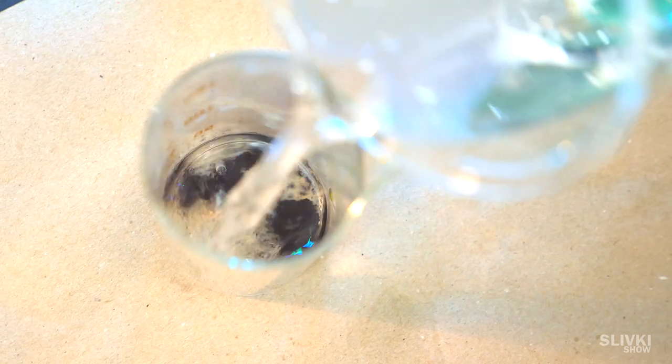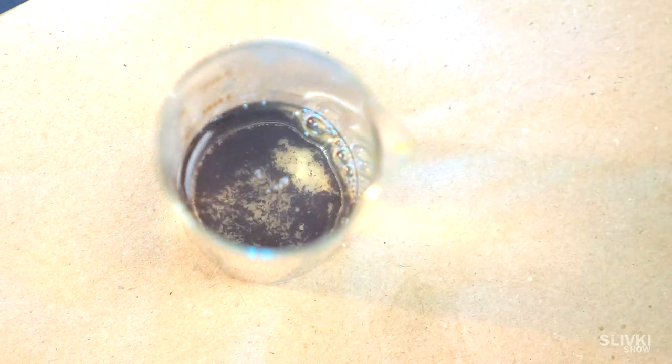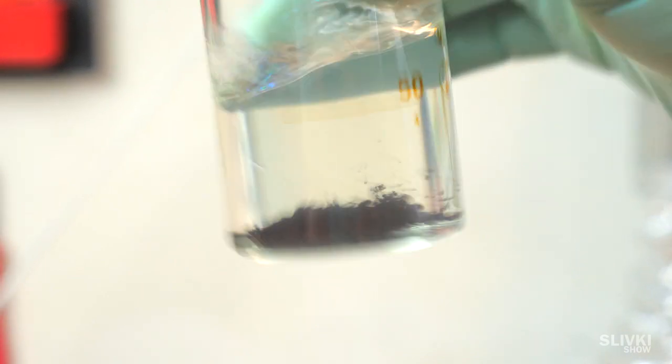Yeah, it has a different color, but we will fix it. We only need to rinse it a few times with water and dry it on the stove.